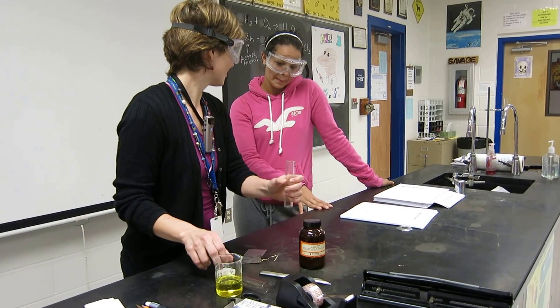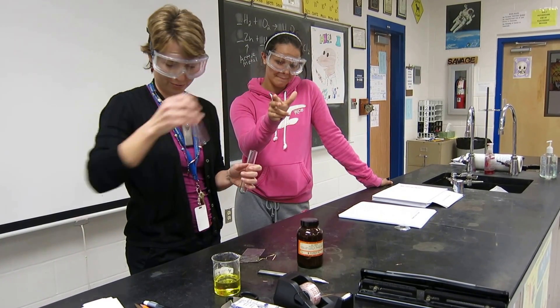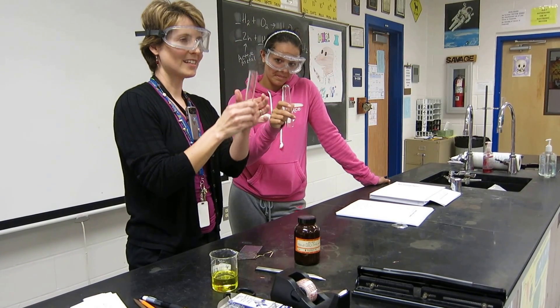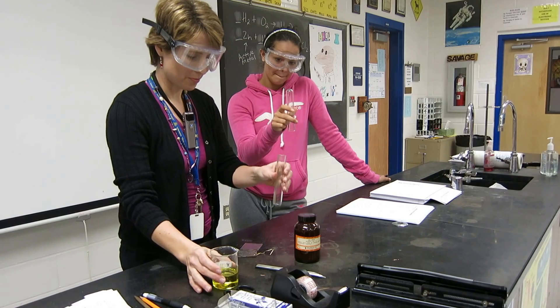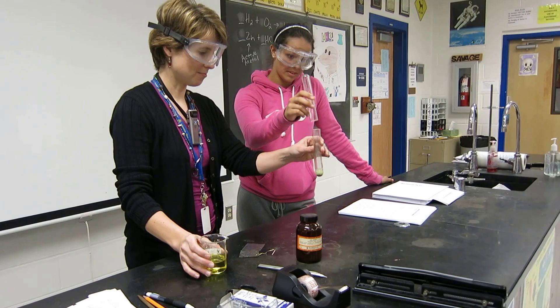So you're probably wondering what your job is in all this. All you have to do is hold the test tube up here. Because what we're going to do — let me get some of this water out, we're going to pretend it's really dry — is add some hydrochloric acid to the zinc. Then Ashton is going to help catch one of the products of this reaction. So all you have to do is hold that test tube over the top here.